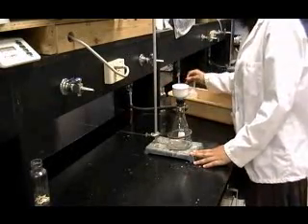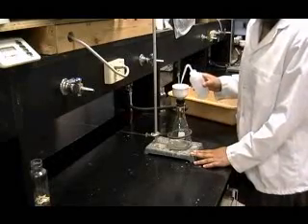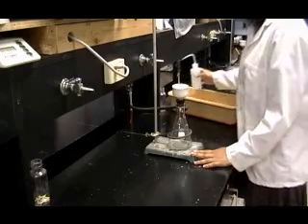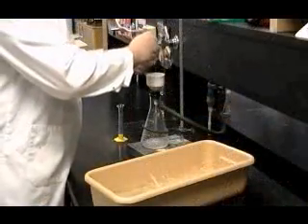In step 9, you will begin filtering your aspirin sample. Place a disk of filter paper in the Buechner funnel so that it covers all of the holes in the flat bottom, and wet it with deionized water from the wash bottle to seal the bottom.